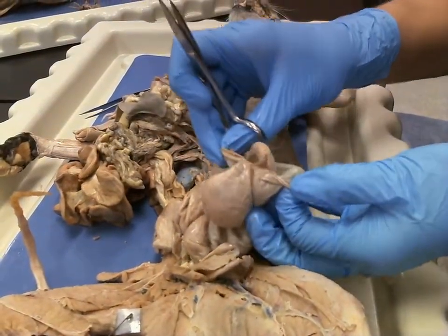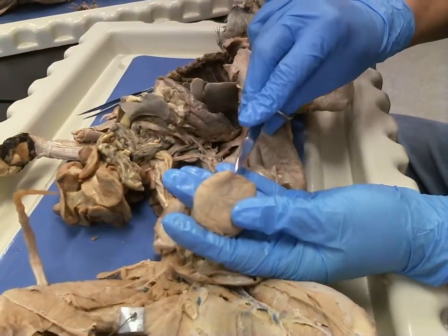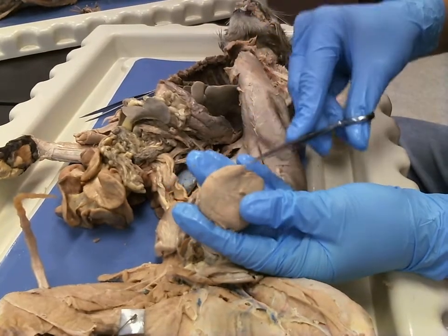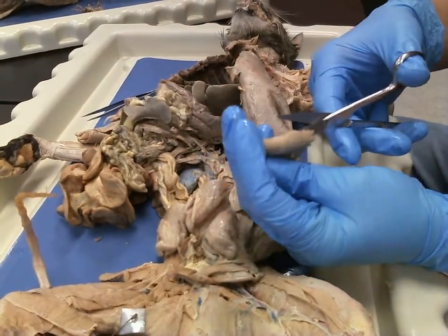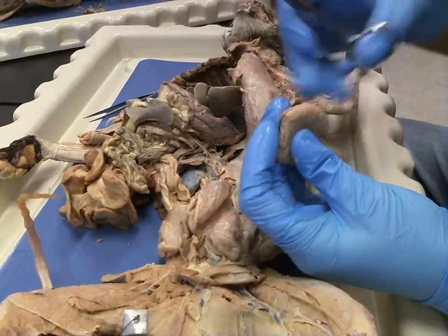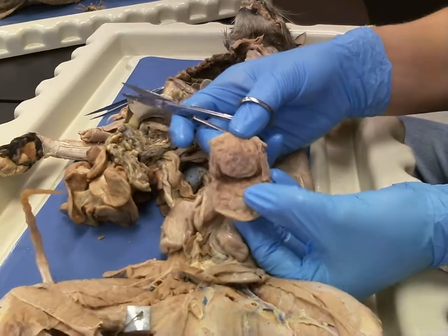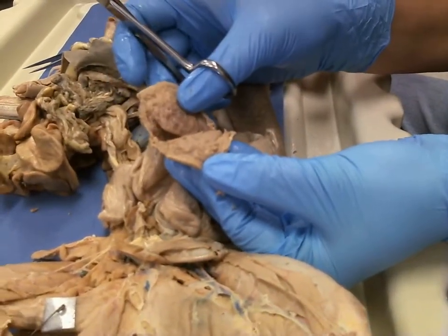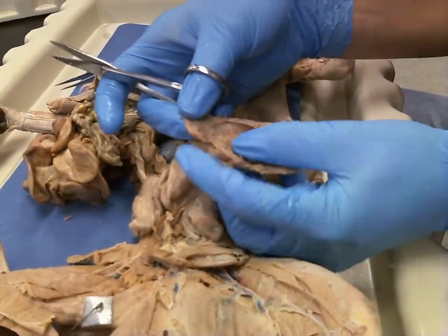you can pull this out, and what you notice is this is the placenta right here, all right? As we dissect that placenta, we can pull it and cut it, and what you then see is that, I call it the fuzzy carpet, that is your chorion, all right? The chorion attaches into the placenta. Now we've got our fetus right here.